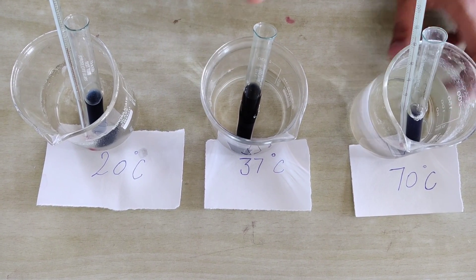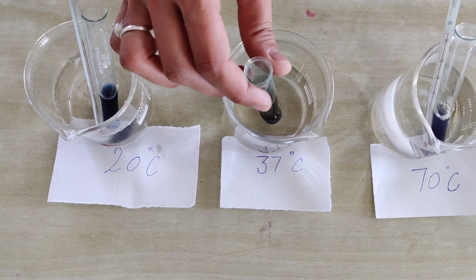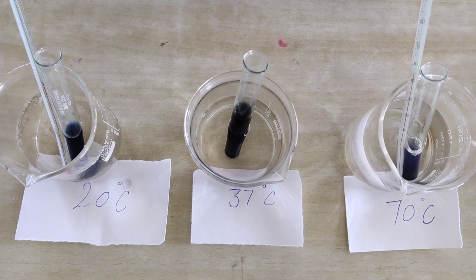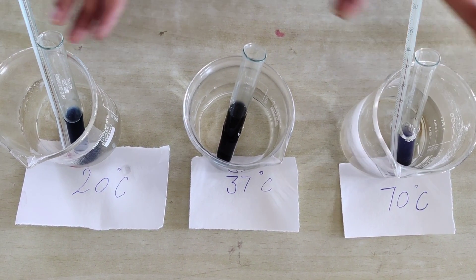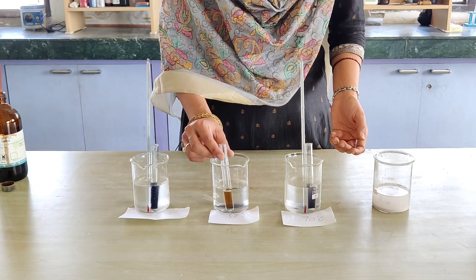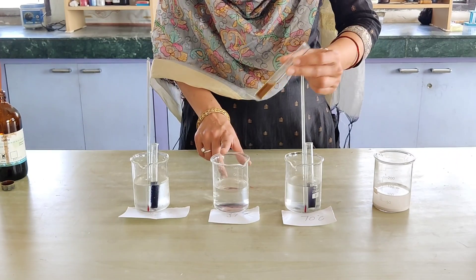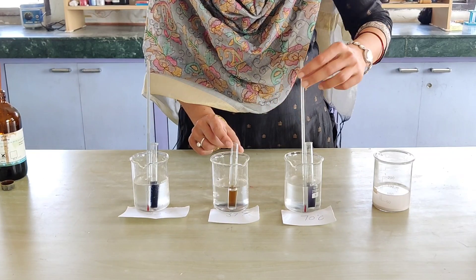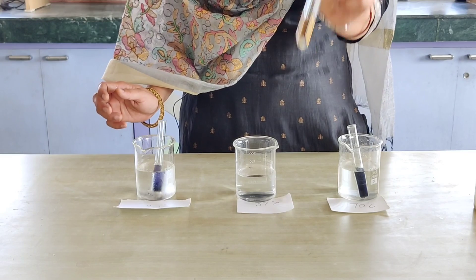Salivary amylase works maximally at 37°C, so we expect the color change to appear first in that test tube. After about 30 minutes of observation, we can see that in the test tube kept at 37°C, the color change has appeared. The salivary amylase has worked on the starch and broken it down into disaccharides, showing maximum activity at 37°C.